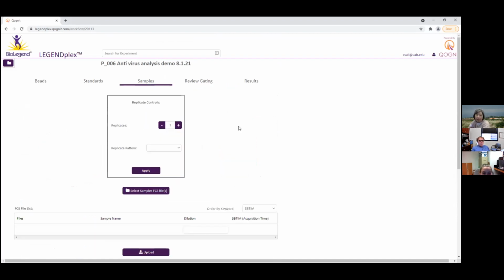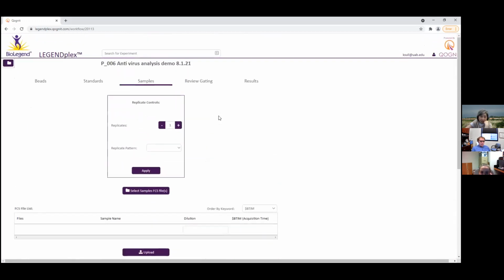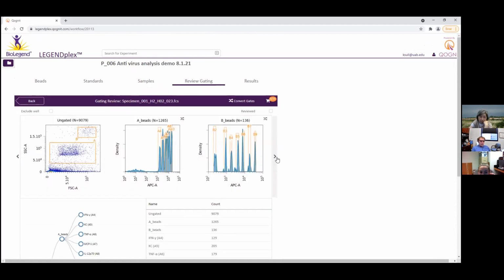I see it just says demo 8.1.21. Why is it a demo? Because we called this the demo, that's what Anthony knows. So the software isn't the demo, the sample is the demo. So basically, when I went to run gating, which I can't show you now because it's already done, it gave me an option to stamp the gating onto all the gates, and then gave me an option here for review. Then when I click review, I can see all the samples.